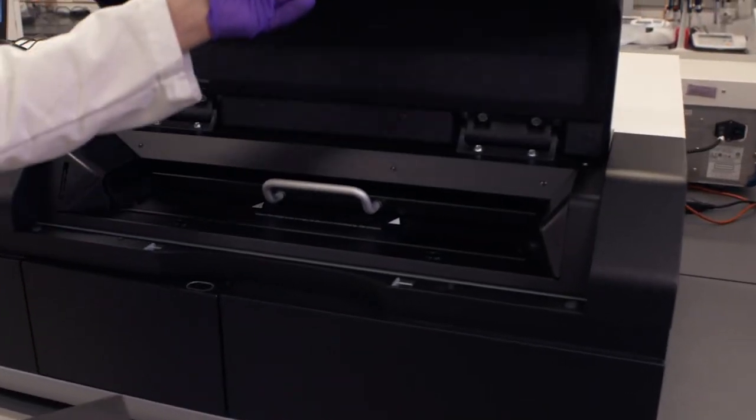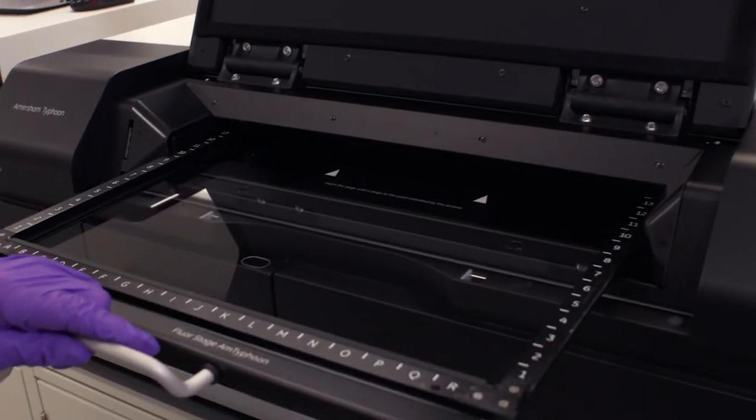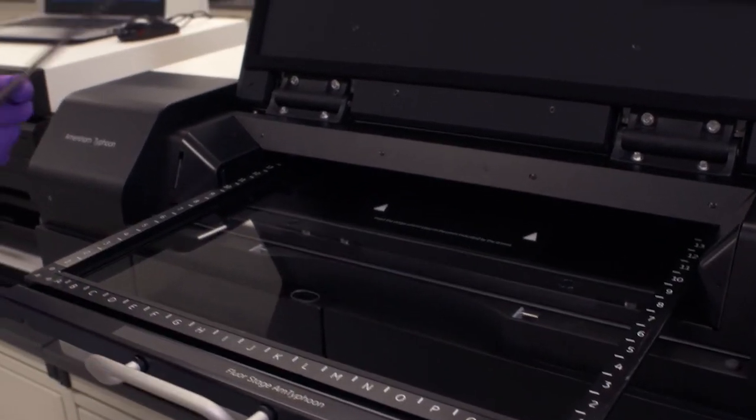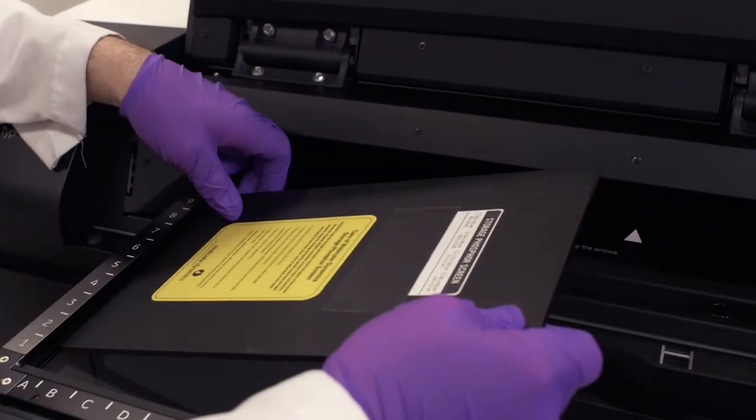We're going to open up the door. In this case, we're going to use the low fluorescent glass stage, but we have to take particular attention when you have a metal back screen against the glass that we're not going to scratch or damage the glass.